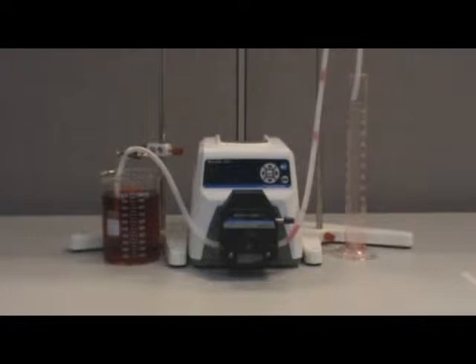For this calibration, we are using size LS15 silicone tubing. As you can see, we already have these items set up to perform the calibration. The clamps and stands are not necessary elements, but they do help to make setup and calibration easier. We also dyed the water red in order to make it more visible. Feel free to use any method that will work safely and conveniently for you.